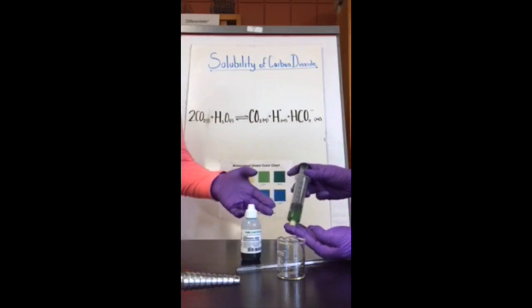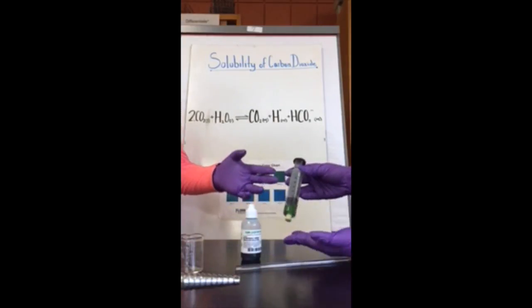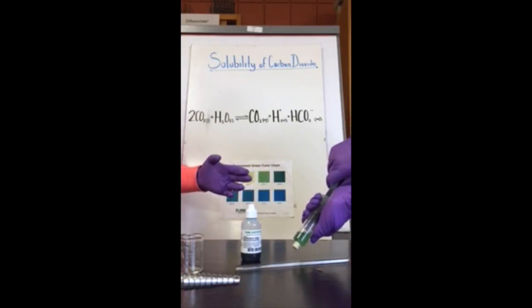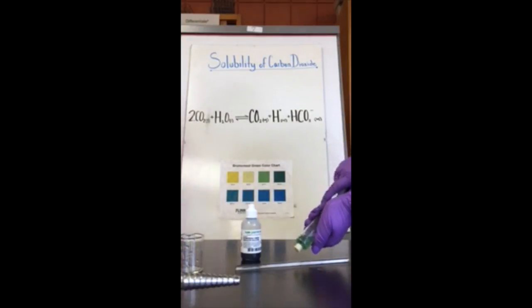Okay, so this is our starting point for this syringe. So now Martha is going to pull back on the syringe, which is increasing the volume and in turn decreasing the pressure. And she's going to start shaking it, which will change the color and the equilibrium.